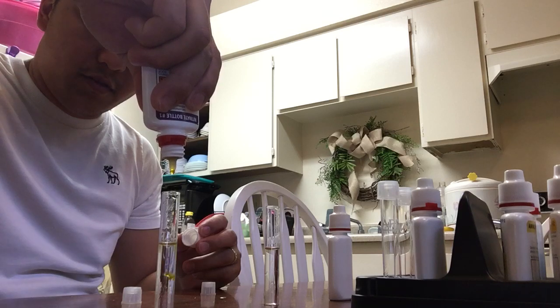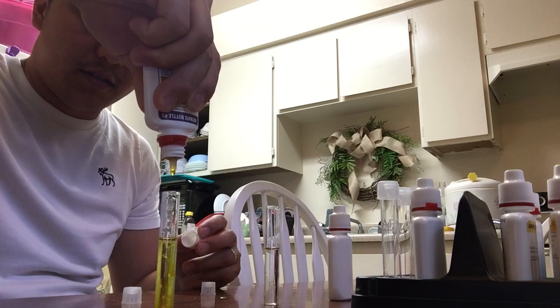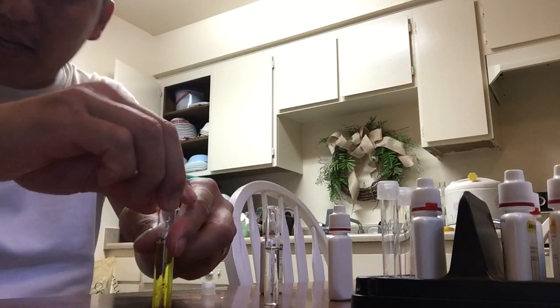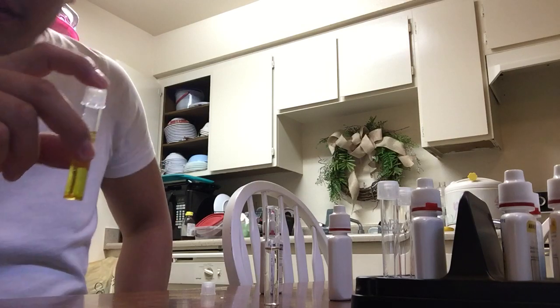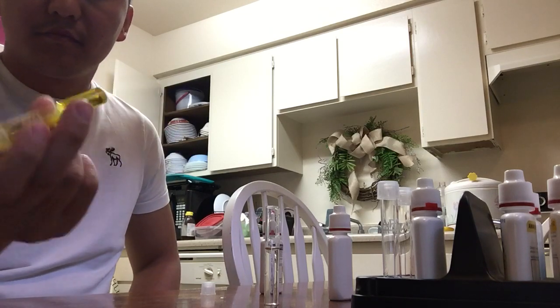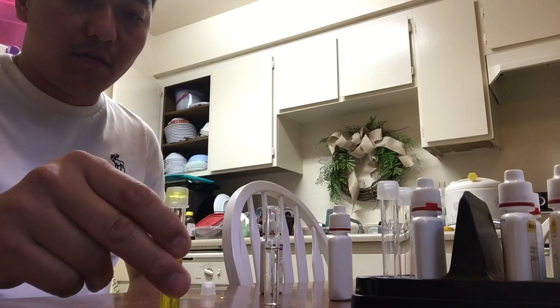1, 2, 3, 4, 5, 6, 7, 8, 9, 10. And we will tap that, hold finger, invert several times.